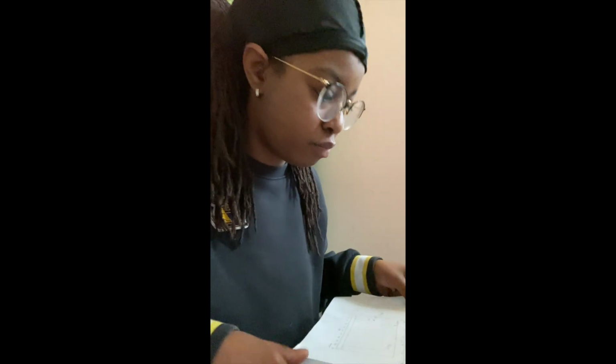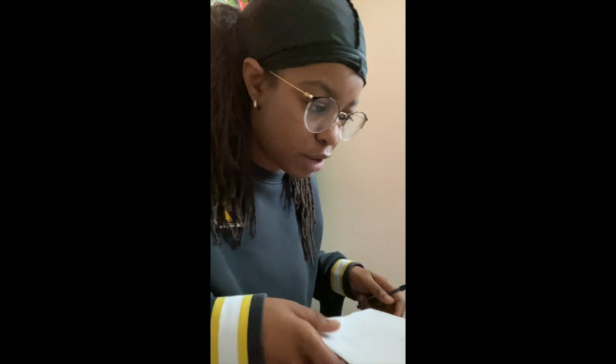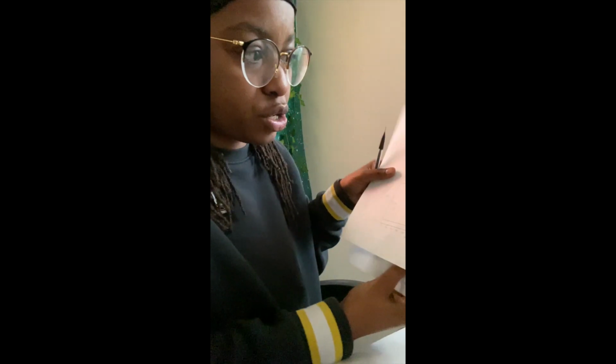All right, so for this assignment, we are supposed to kind of show our process about how we propose a structure, given the molecular formula and determine the saturation level, and giving different graphs on the spectra: IR, 13C NMR, and the 1H NMR spectrum. I have my completed worksheets right here, just so you guys can see.